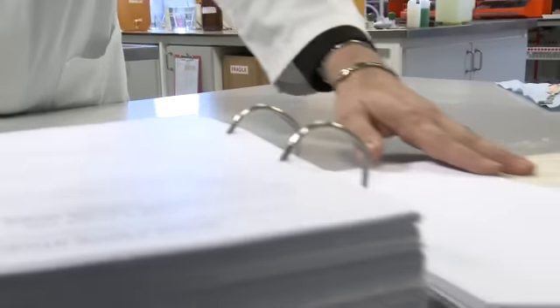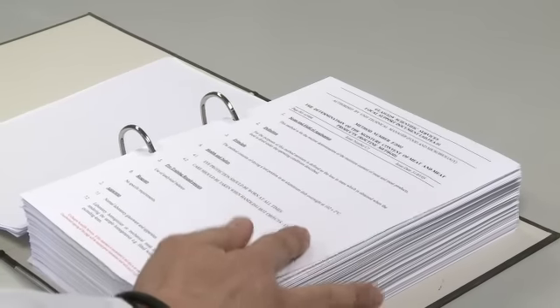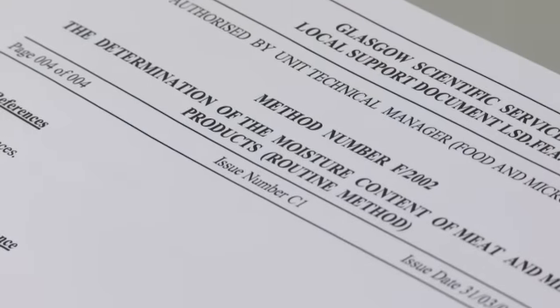For all procedures carried out within the laboratory, there are detailed procedures, either based on British standards or in-house UKAS accredited methods. The procedure is detailed in such a manner that it is very easy to follow, similar to that followed in any laboratory, including school laboratories.